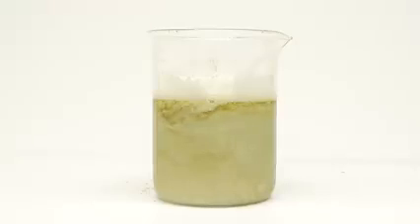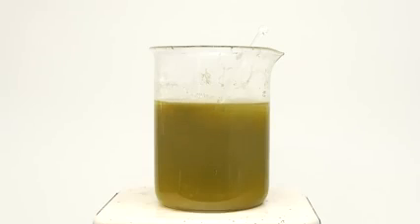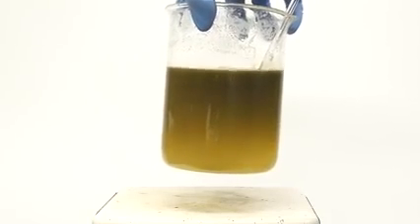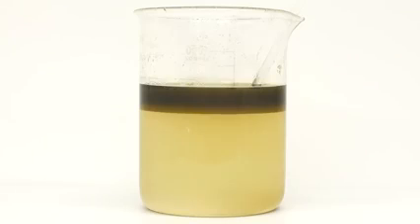The idea here is to keep adding hydrochloric acid until I get to a pH of around 1 or 2. This is definitely overkill, but by making things really acidic, we can be sure that we've reacted everything. After I got to my target pH, I continued to let things stir for about 10 or 15 minutes. When I come back and take the beaker off the stir plate, the fatty acids quickly start floating to the top.